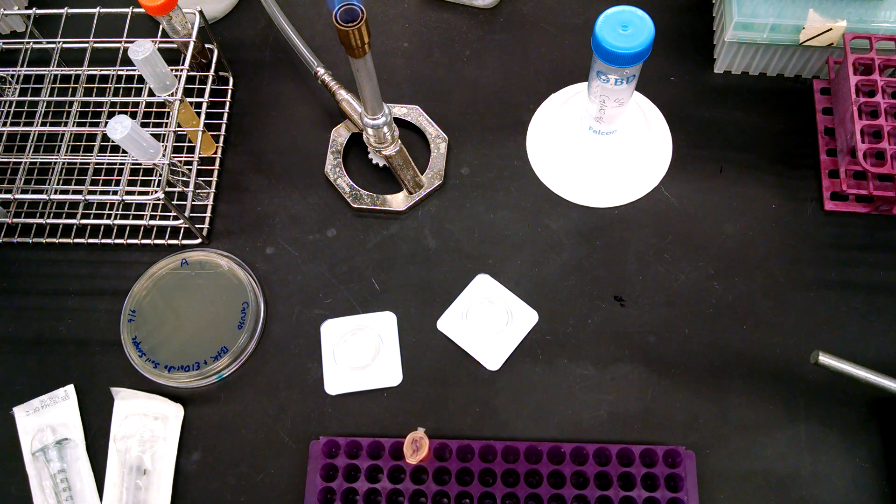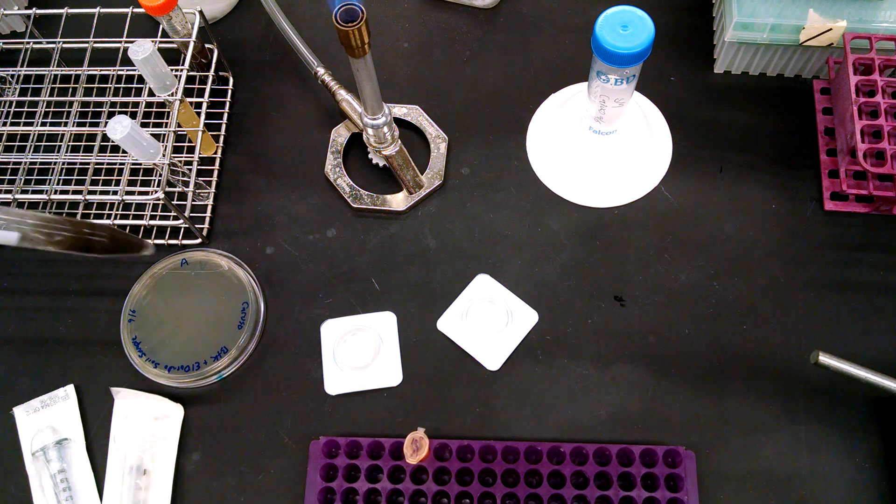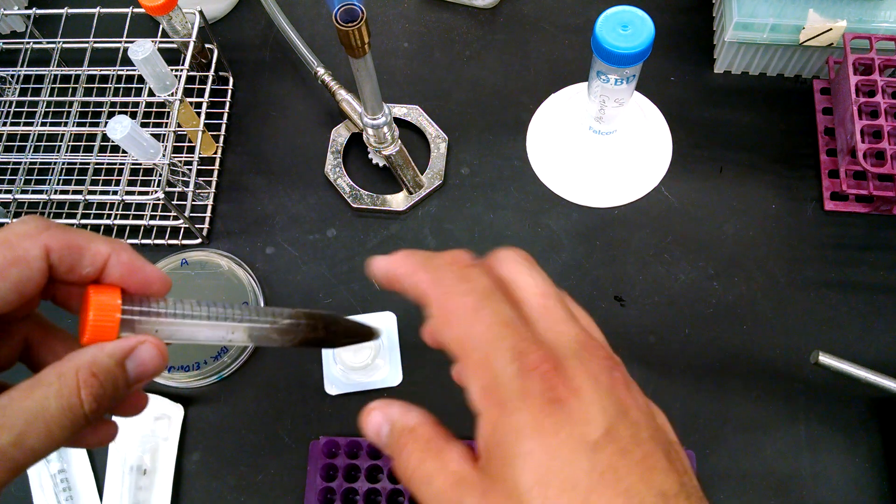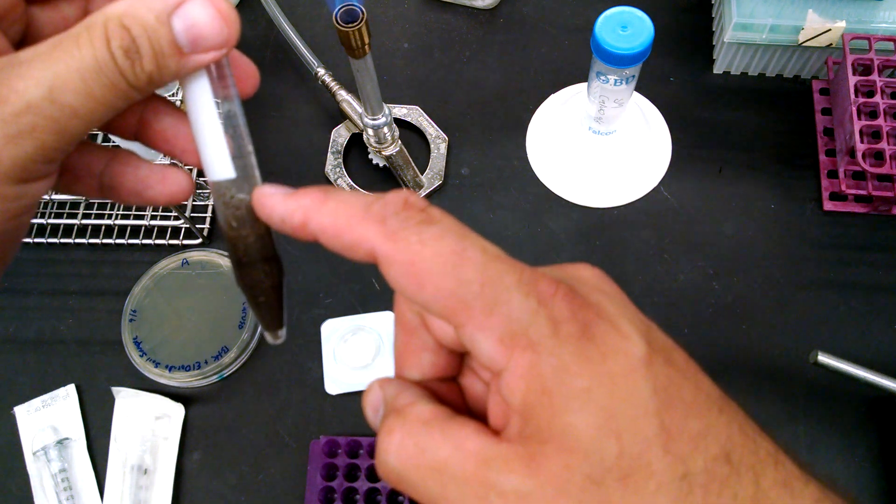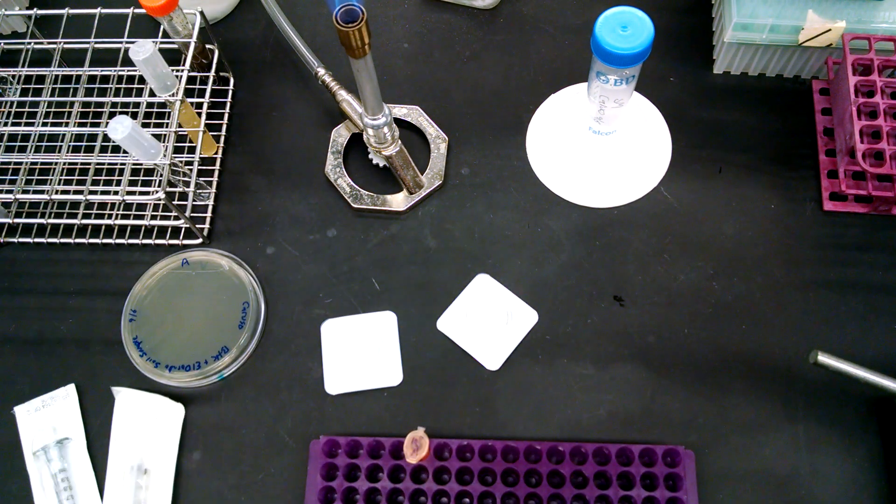Remember, what you want to do is you want to take your soil samples for direct plating, and you're going to cover them. You're going to add SM buffer until it just covers the sample.